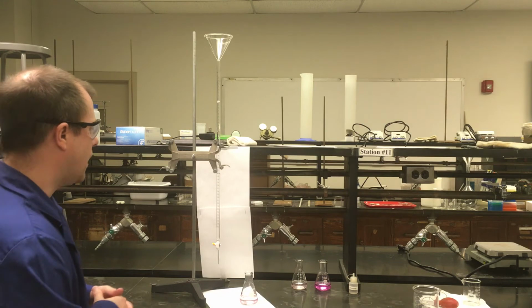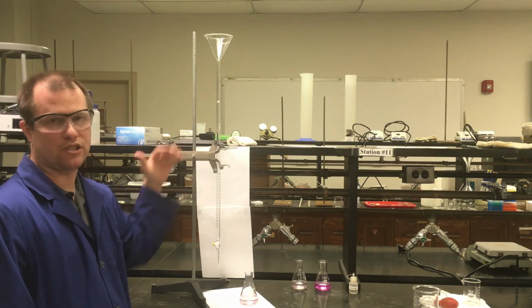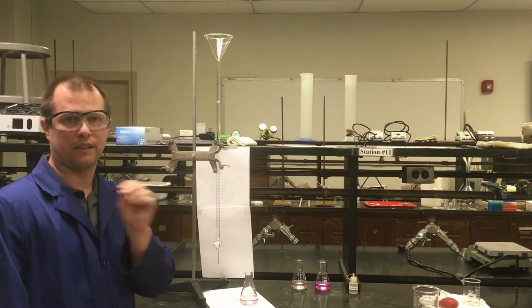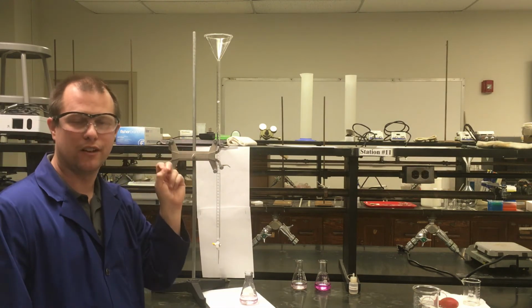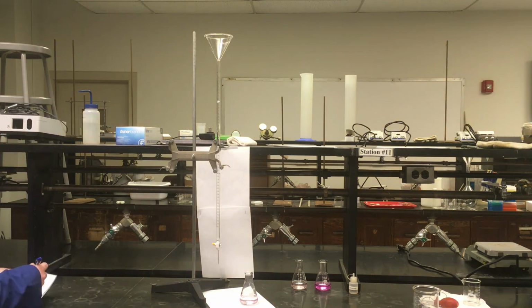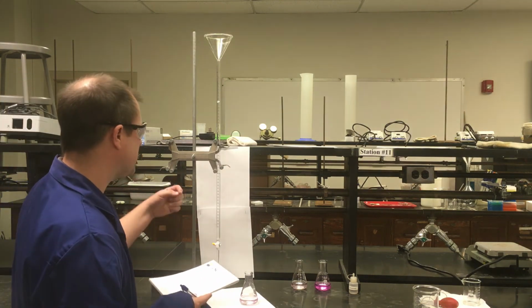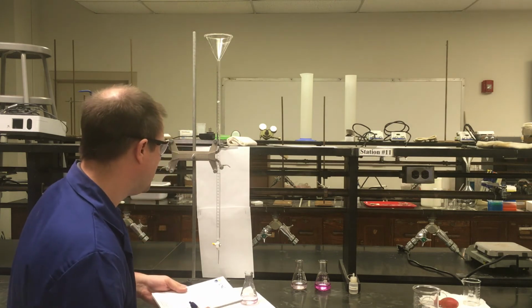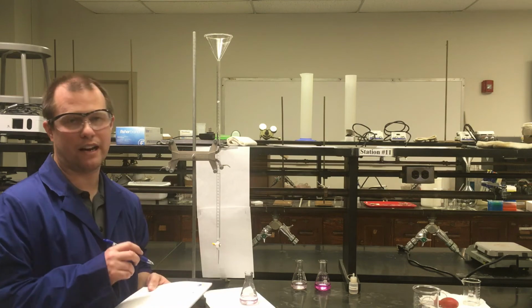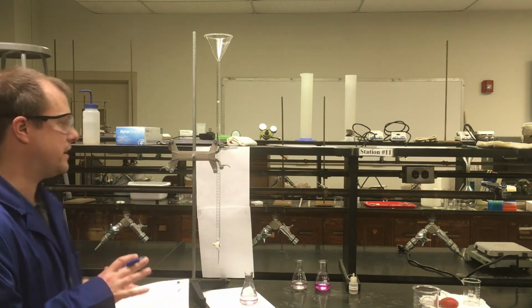It's good. Now I should be done as far as how much I've actually added. Now, I did have to go back, unfortunately, and make an adjustment from my video cutting out the first time I was in the process of draining this. So I'm actually going to give you the measurements that we are going to need to use here. This final volume measurement looks like it's about 32.70 milliliters. And I started this one actually at 9.12 as a starting point.